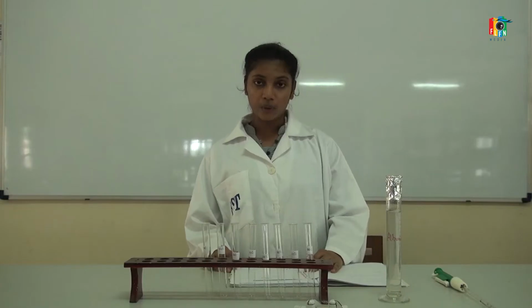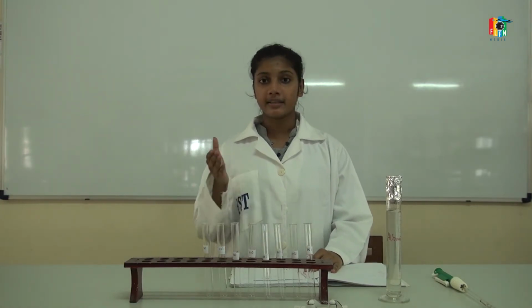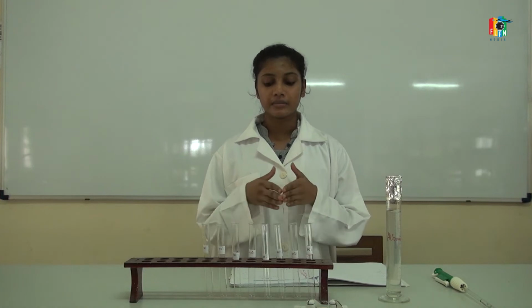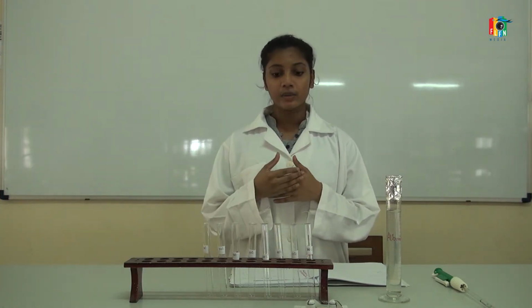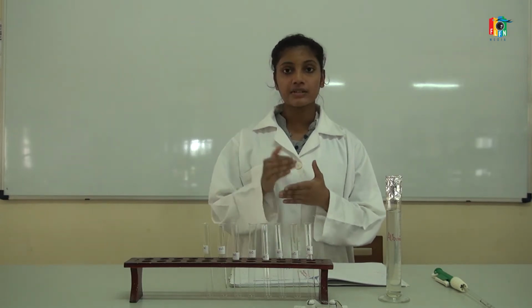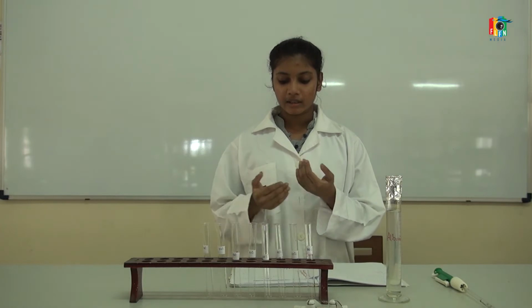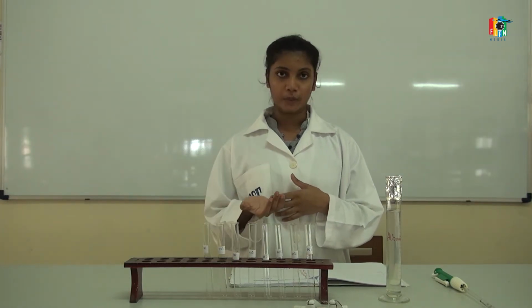As you all know, there is a linear relationship between the concentration and the absorbance. You can measure it by the Beer-Lambert law. So in this practical, we are going to measure how the coagulation is developing. So the concentration is linearly equal to the absorbance.